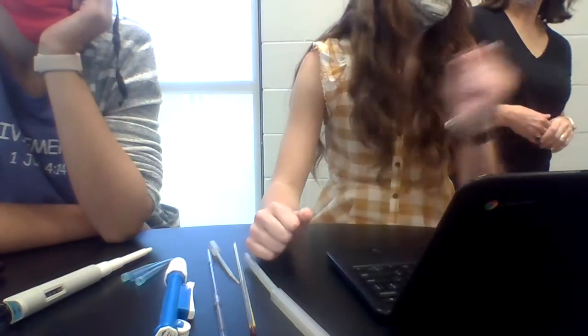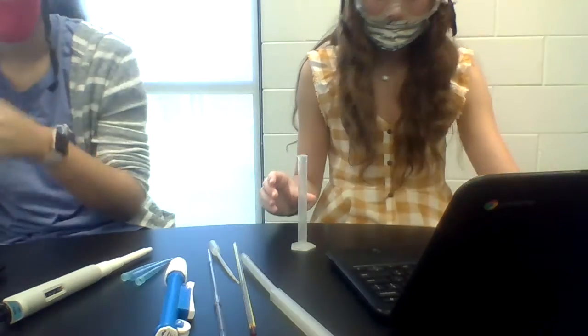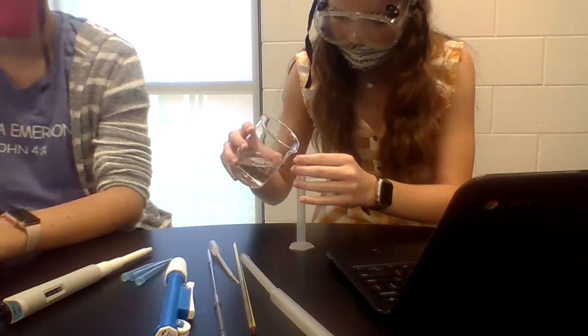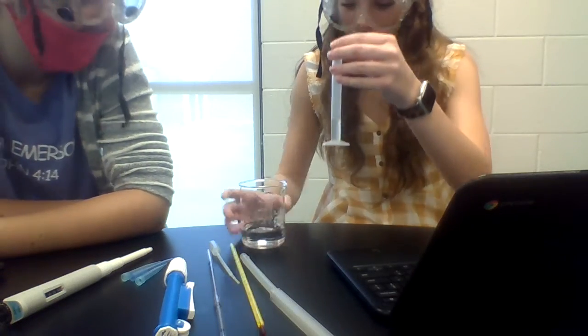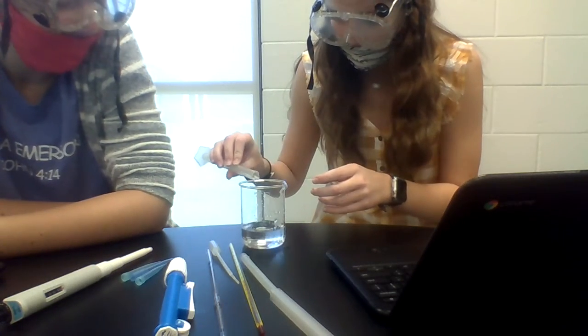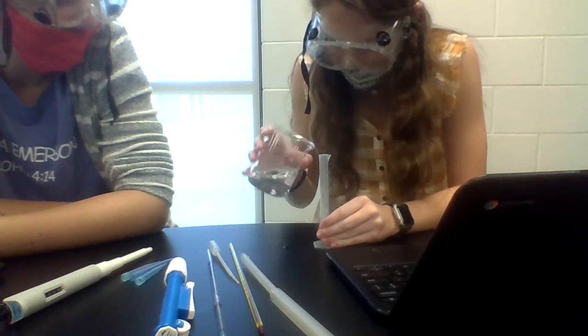Alright. Pass me the cylinder. Oh, I should get y'all another graduated cylinder. Oh, that was a little much. I spilled on the table. Almost there.